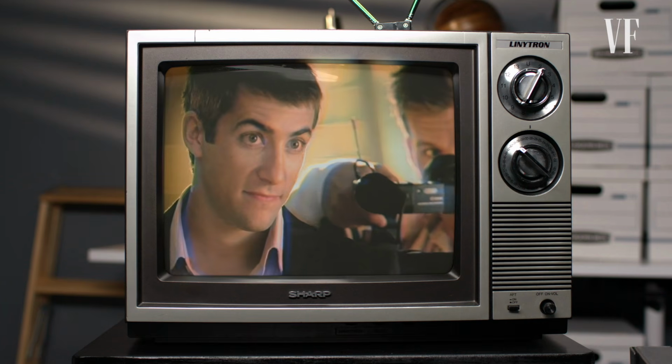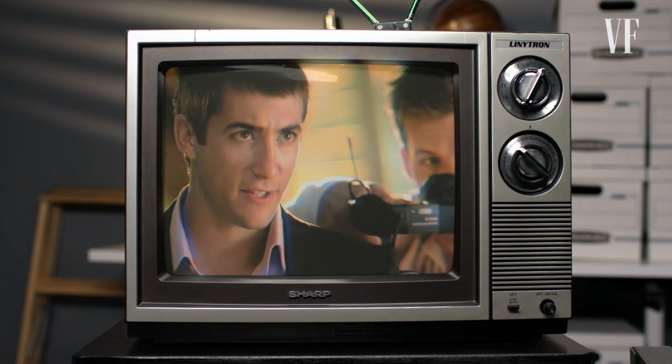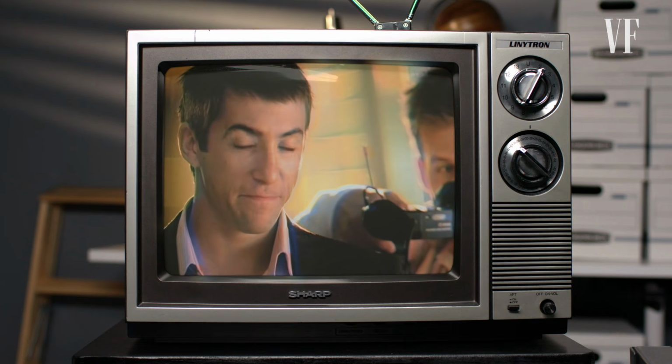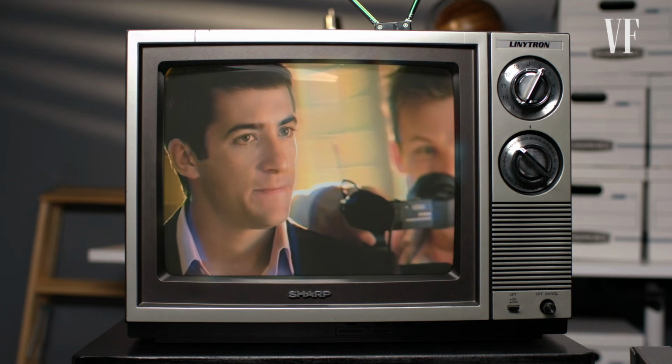My results are 0 zip. There's no DNA on the jacket. I don't see how that's possible. The luminol gave a significant blood spatter. It was actually more than significant. You should have seen it glow. It was amazing. Oh, I bet it was.